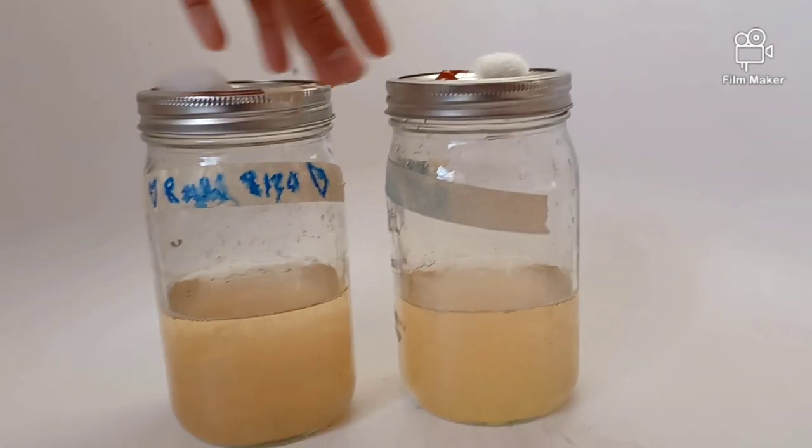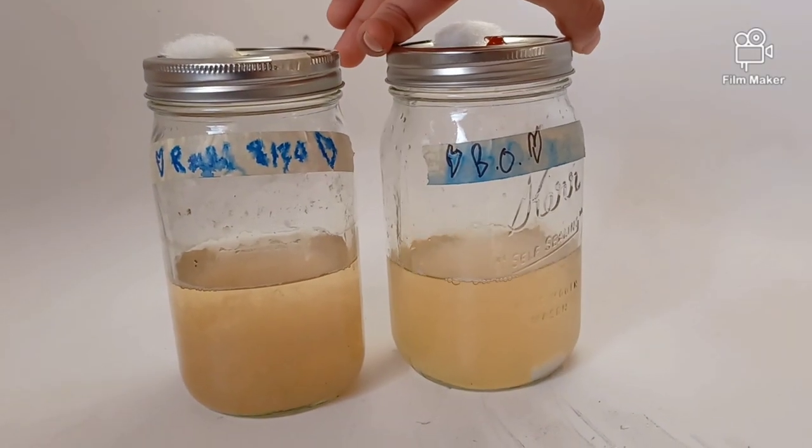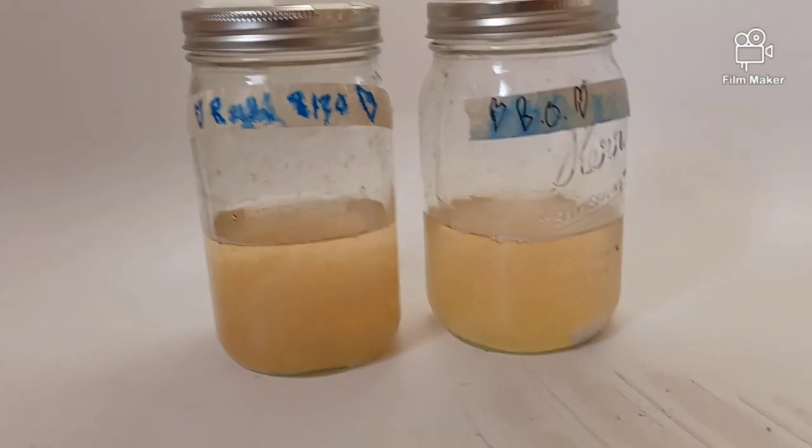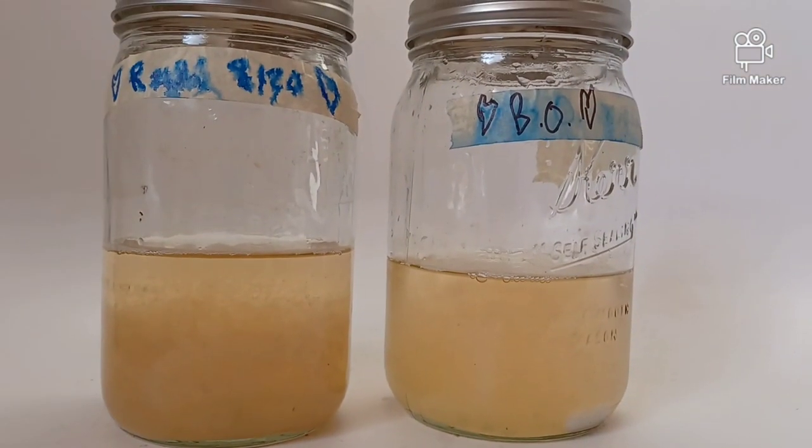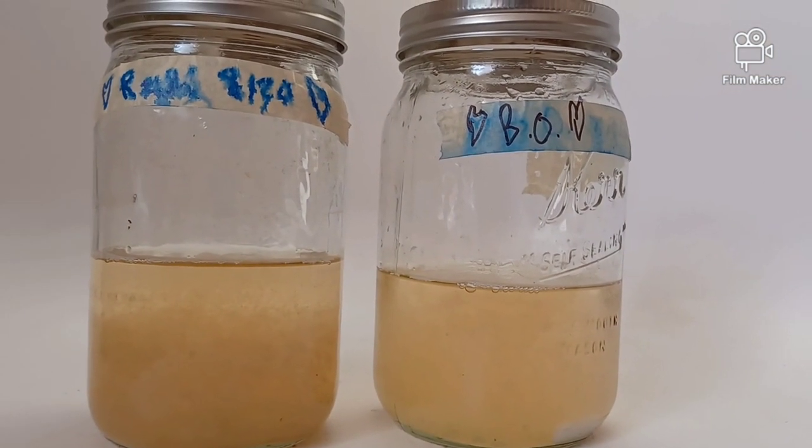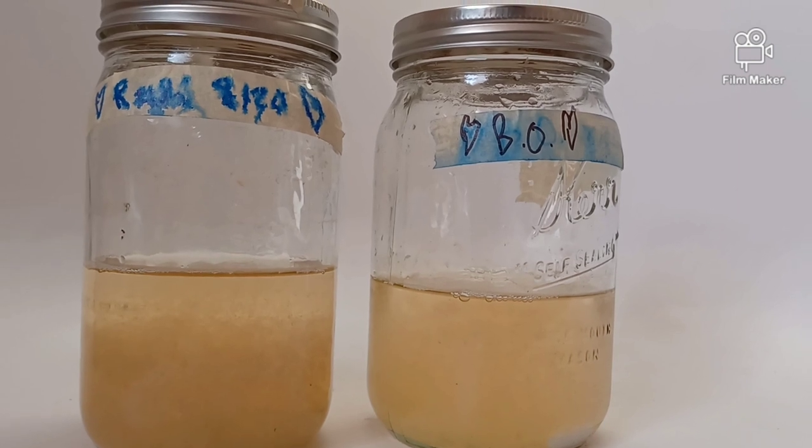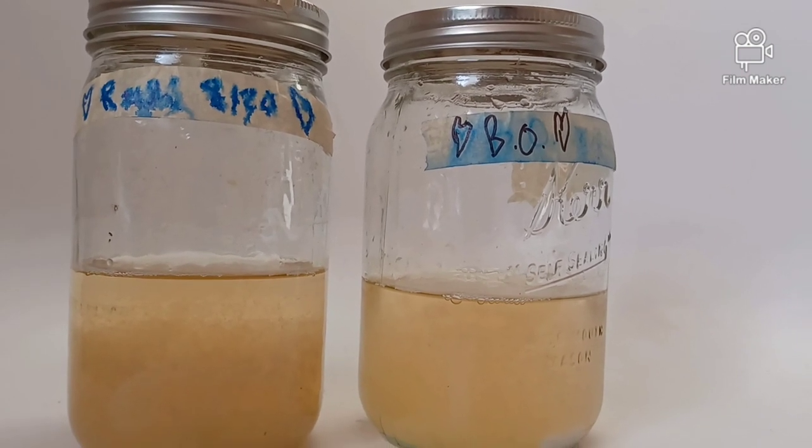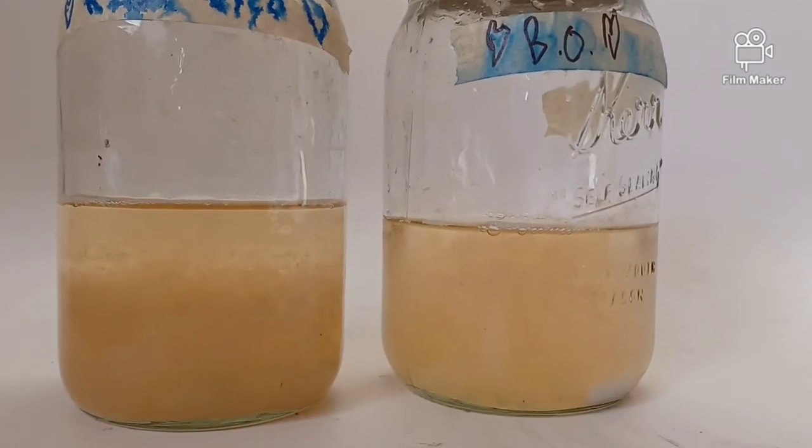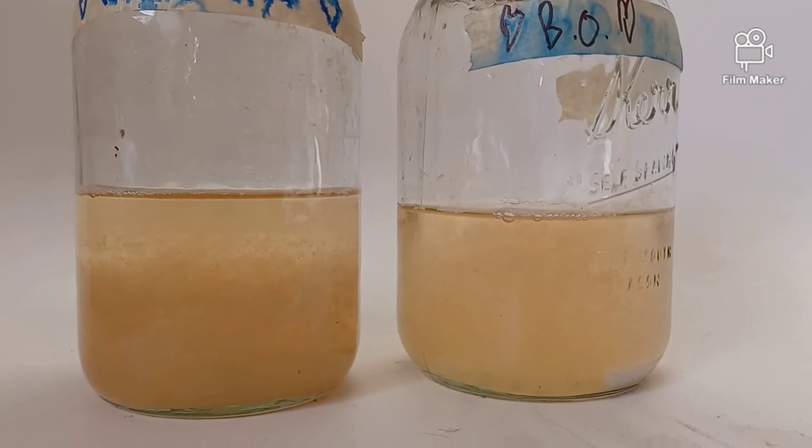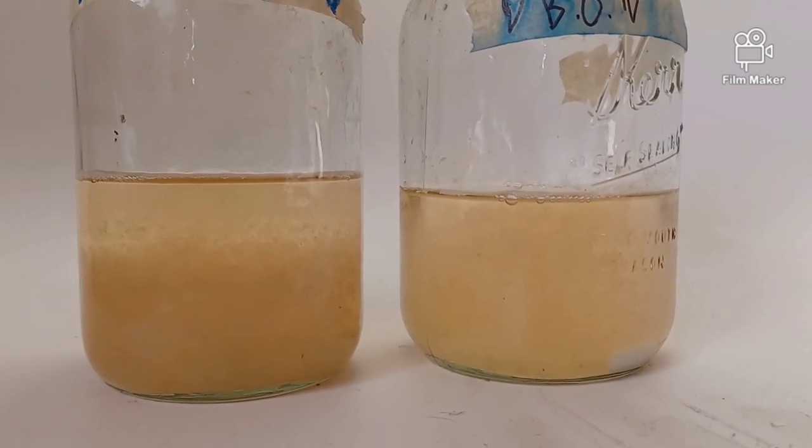Here I have a Reishi and a Blue Oyster liquid culture. They have both been sitting in the fridge for over a month now. It has been just over two months since they were first inoculated with liquid culture.